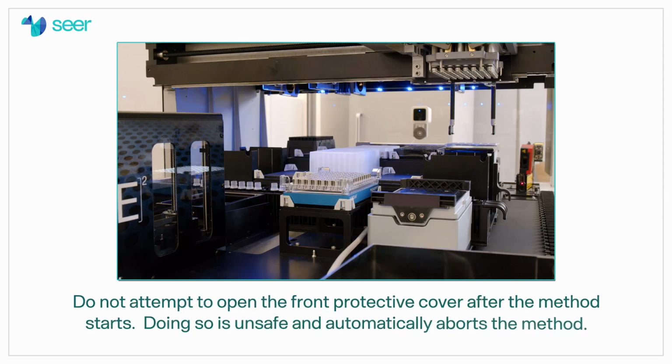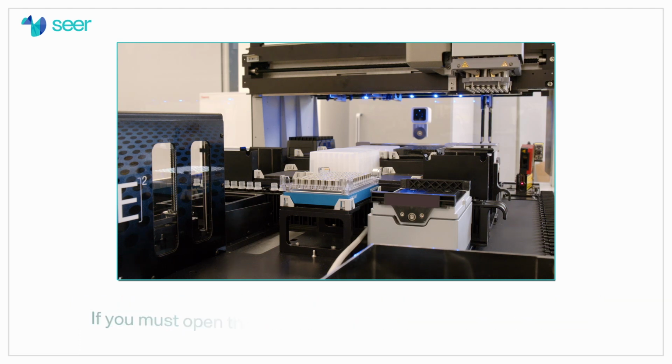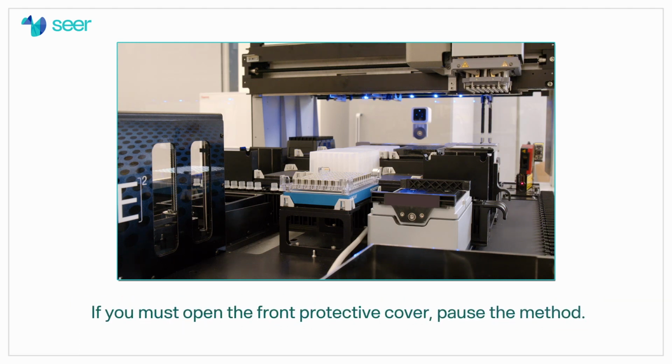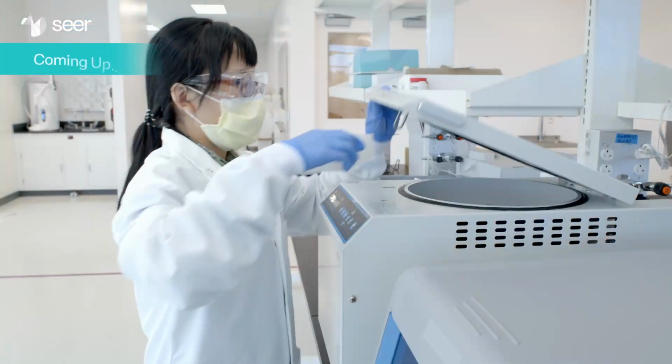Do not attempt to open the front protective cover after the method starts. Doing so is unsafe and automatically aborts the method. If you must open the front protective cover, pause the method. We loaded the deck and started peptide quantification. Next, we will dry the peptides.